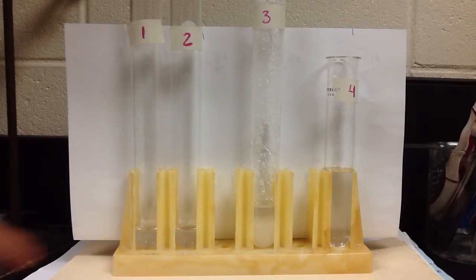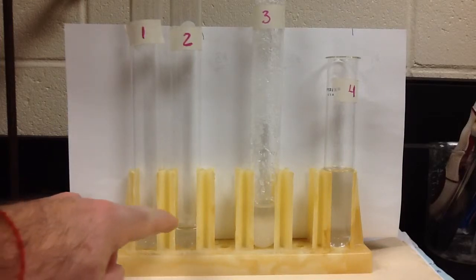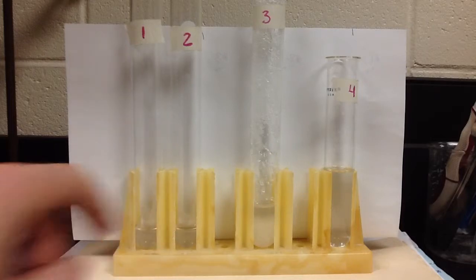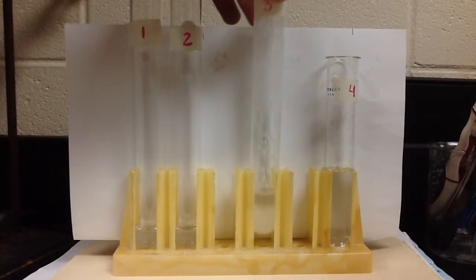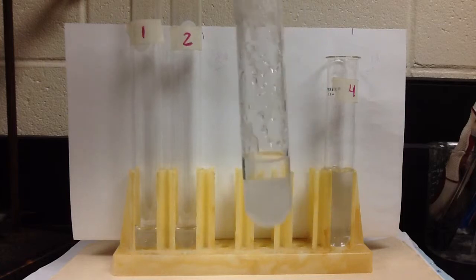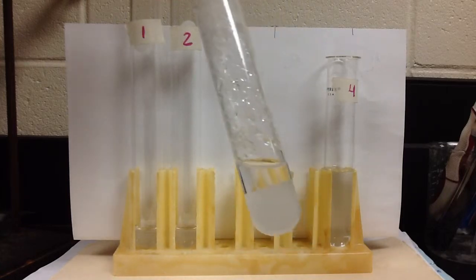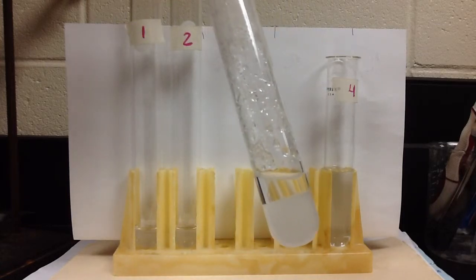So far we've added 0.5 grams and it dissolved. We added another 0.5 grams and it dissolved. Then we went crazy. We added 14 grams of sodium acetate, and we shook it for like three minutes. A couple interesting things happened. One is that it felt like it got cold, but then we can see there's a whole lot of chemical that did not dissolve.